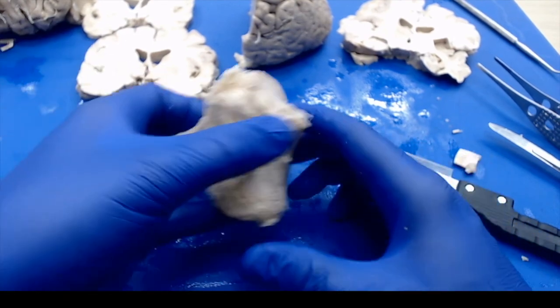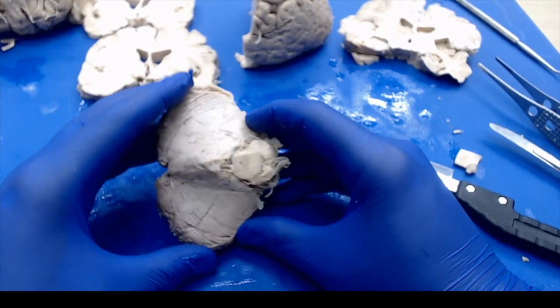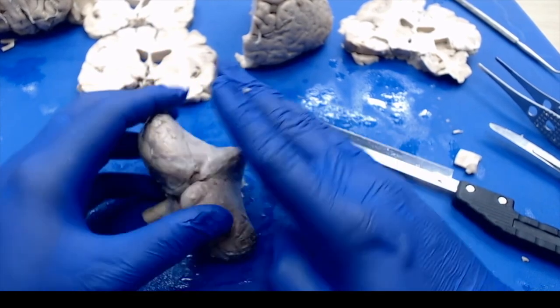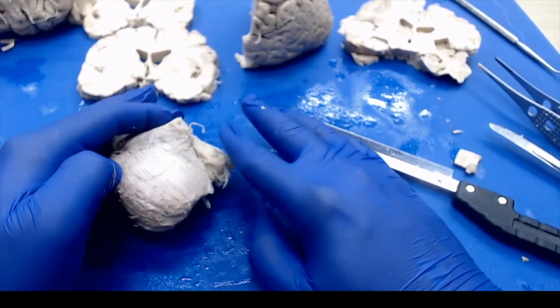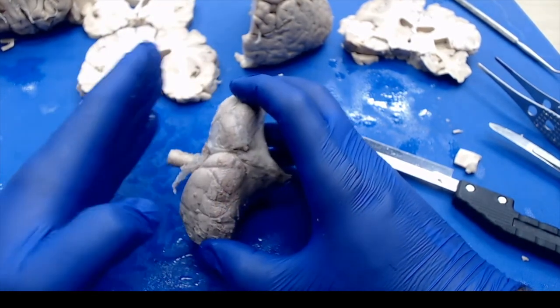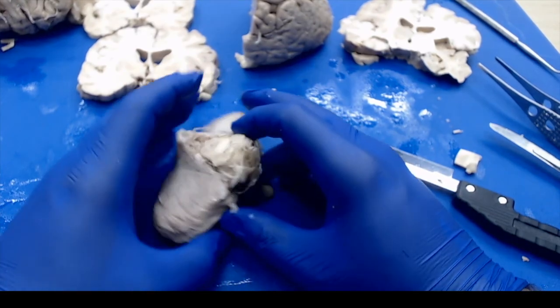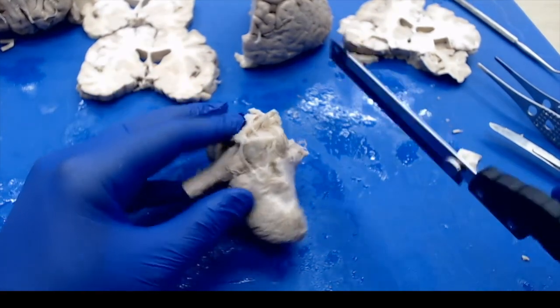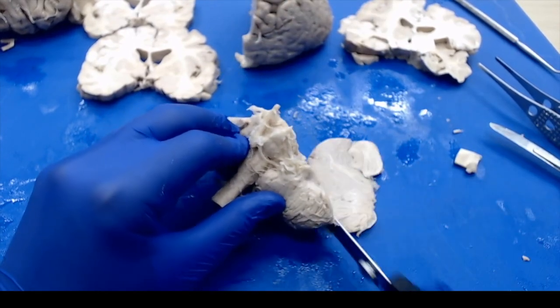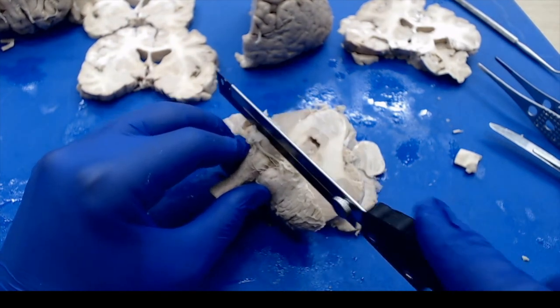Finally, with the brainstem removed, now we want to kind of section that and look at any potential abnormalities there. Now, you have a couple of ways you can do this. You can either do it from a superior to inferior approach, so we've already kind of cut our superior at the brainstem, and we can just go all the way to the spinal cord. Otherwise, you can do an anterior to posterior approach. I'm going to do the superior to inferior approach. That way I can see the relationship from the cerebellum to the brainstem. So again, we'll serially section, and we can lay this out.